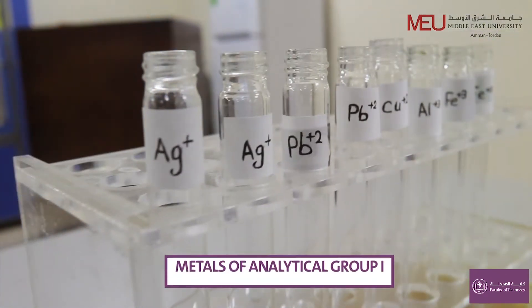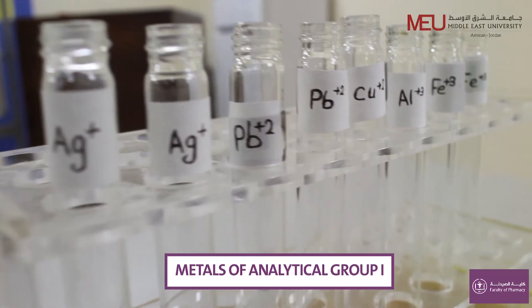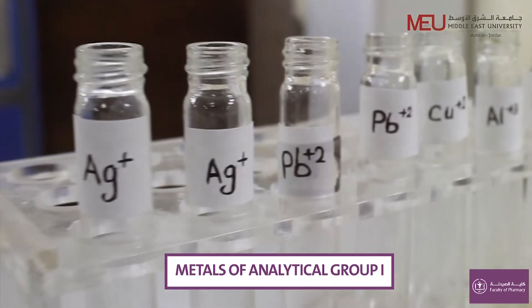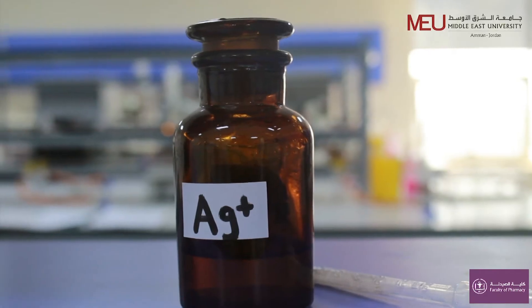The group 1 ions that we will be testing for today include silver ion and lead ion. The metal ions of this group are separated as their insoluble chloride.